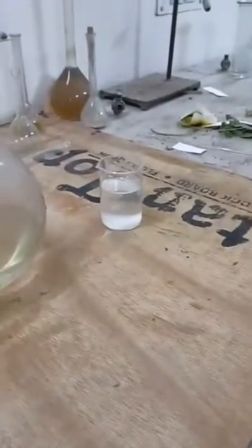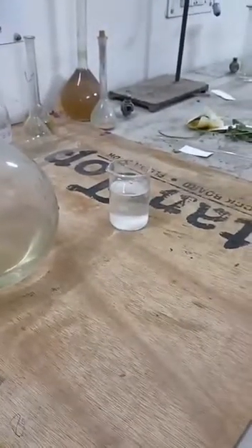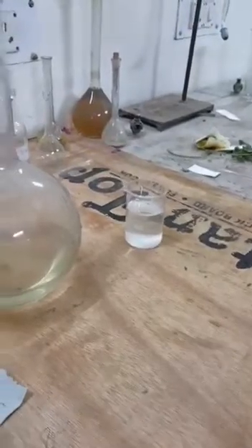This is our indicator in which we have taken 1 gram of starch and then we had boiled it for 2-3 minutes. Then we had added 3 gram of potassium iodide in it and then we had added 2-3 drops of chloroform.